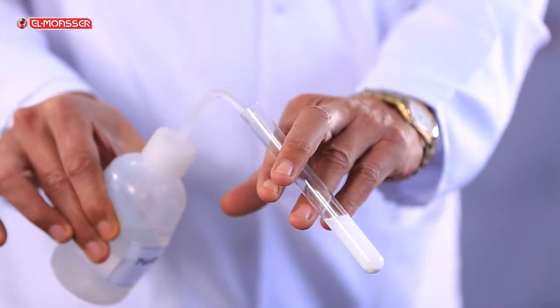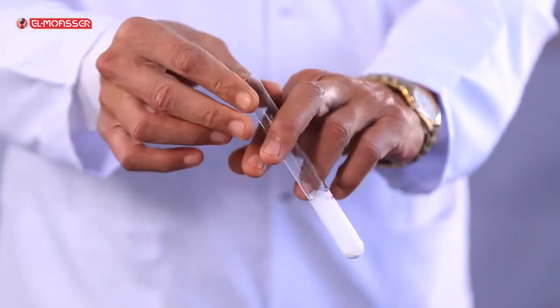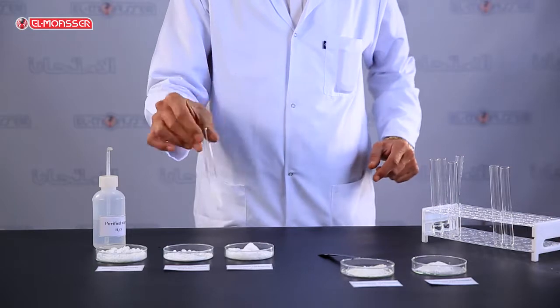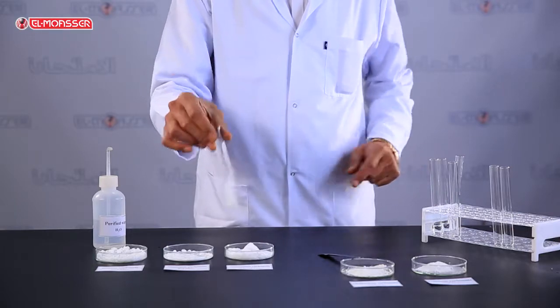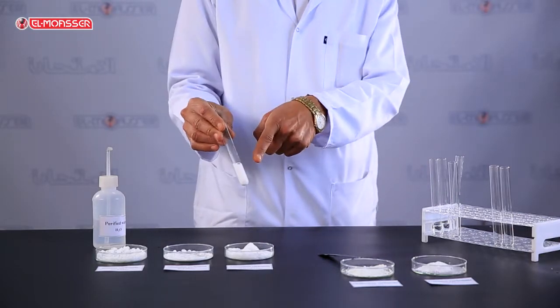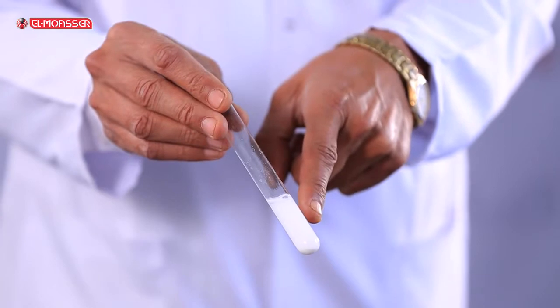Shake well. What do you observe? The magnesium carbonate also doesn't dissolve.